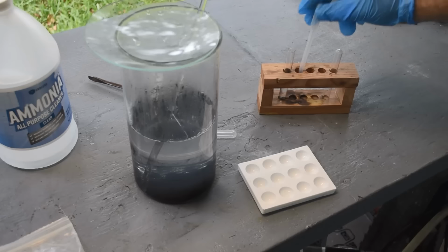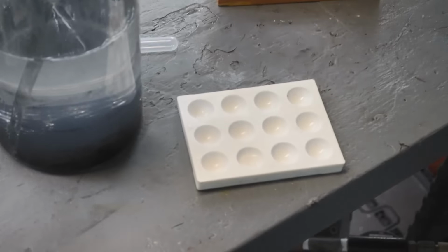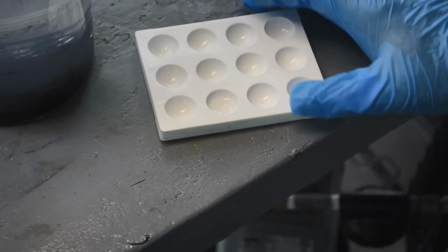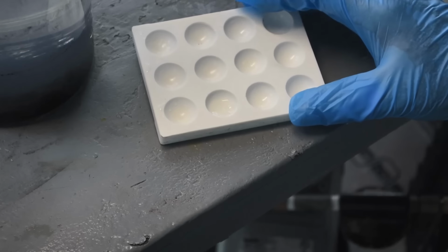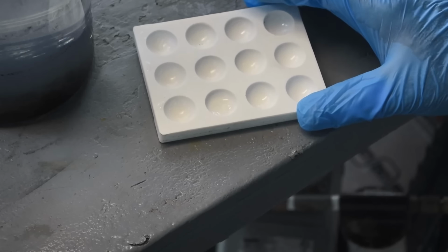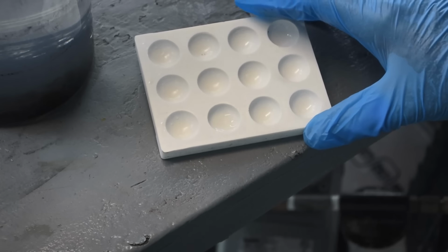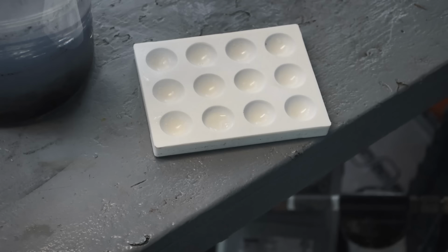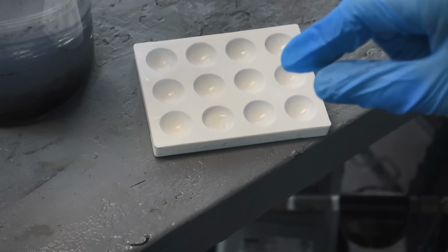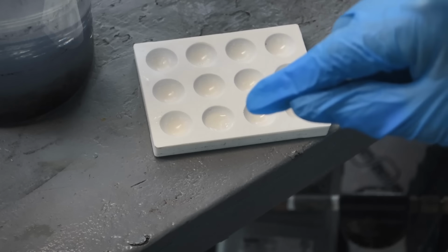Well, a whole lot of nothing going on there. Sure doesn't look like there's anything there. Well, actually, now that it's sitting there for a few seconds, I don't know if it's showing up on the camera. Probably not. It's got a very slight pink color to it. Very, very slight. Nothing to get excited about. But we all know what the pink color is when you're doing a stannous chloride test, right? It's rhodium.